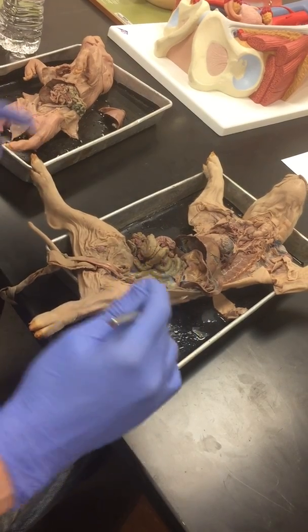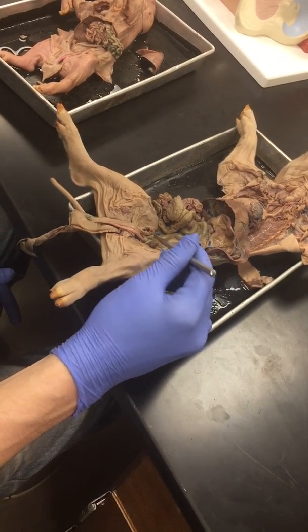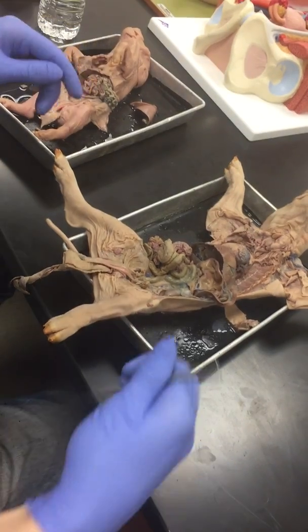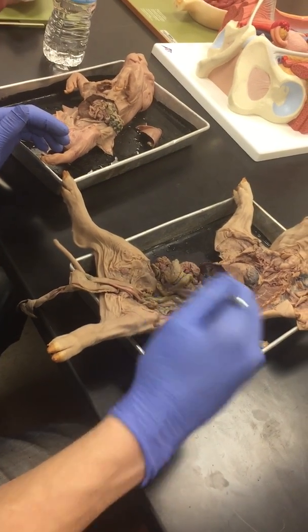So ovaries, you're going to definitely see the uterine horn down here at the base of the bladder. So here's the bladder, and you're going to see 2 pretty loose, kind of squiggly structures, looks like ramen noodles, coming out of the base of the bladder, and you're actually going to have the ovaries attached to it. You'll see the ovaries really good.